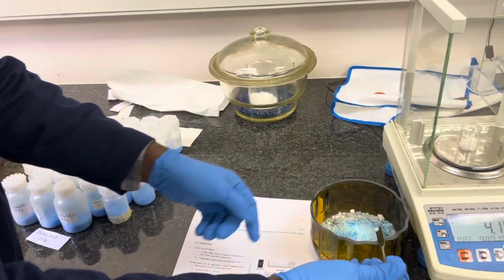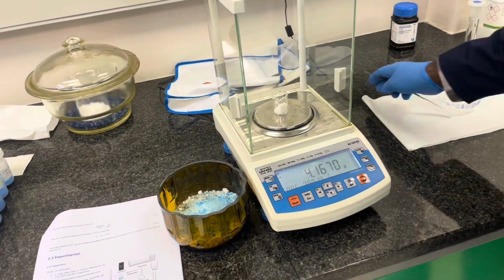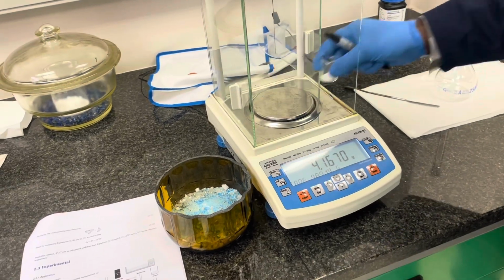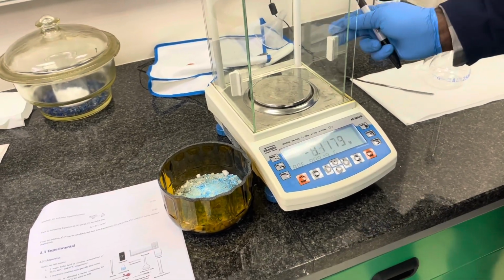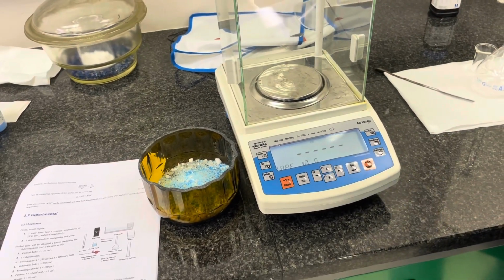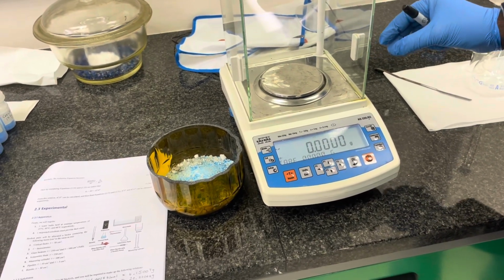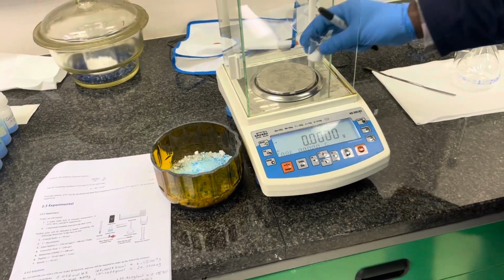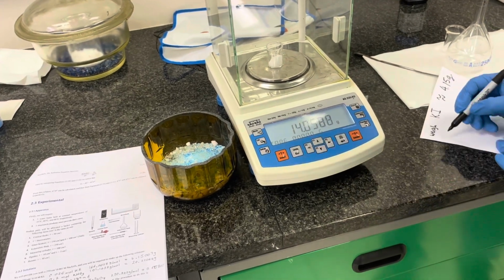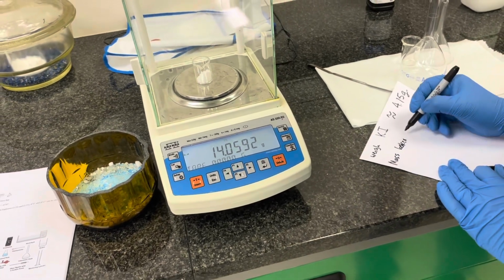Now, transfer all the excess to the waste beaker provided. This will be the same beaker you will use. Put that in there and record your final mass that you have collected. Now, in the next step, you are going to zero your scale and you're going to record the mass of the beaker plus the weight of your sample, because we are going to use a technique called weighing by difference, as this will make sense in a moment. So record the mass of the beaker plus your sample, as Joel indicates in the video.